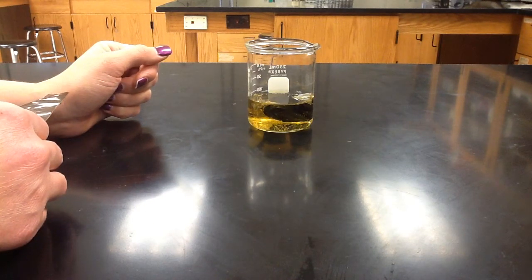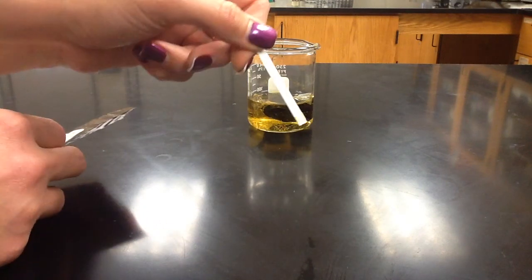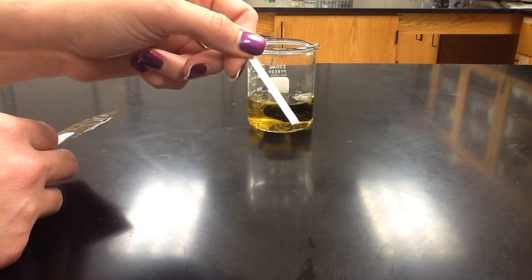The first thing we're going to do is Ms. Ginatoni here is going to take a glucose test strip and dip it into the solution in the beaker.